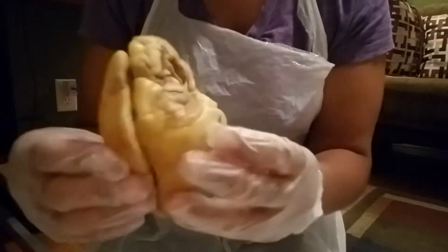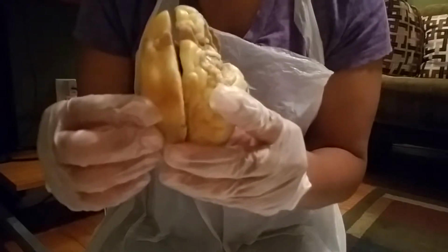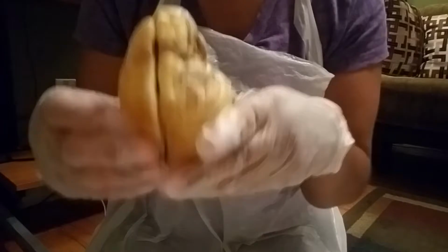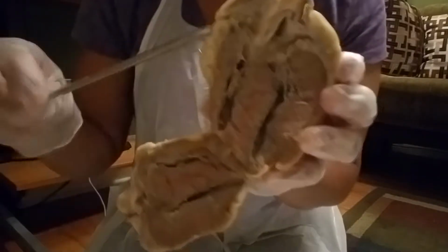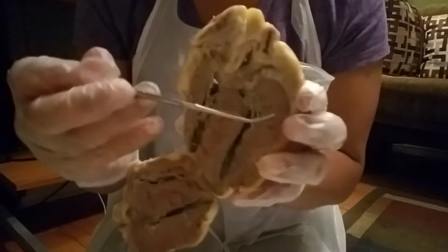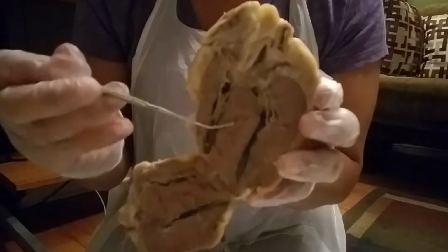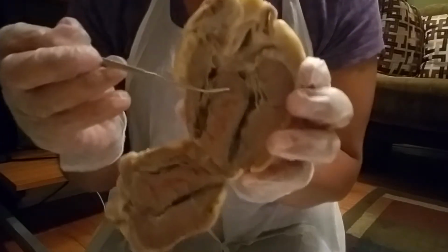If you remember in my last video, I mentioned how I made a coronal cut into the sheep heart, and it opens up kind of like a book. And we will start on this side. This thick muscle tissue is known as the myocardium. Myo means muscle, cardium refers to the heart.